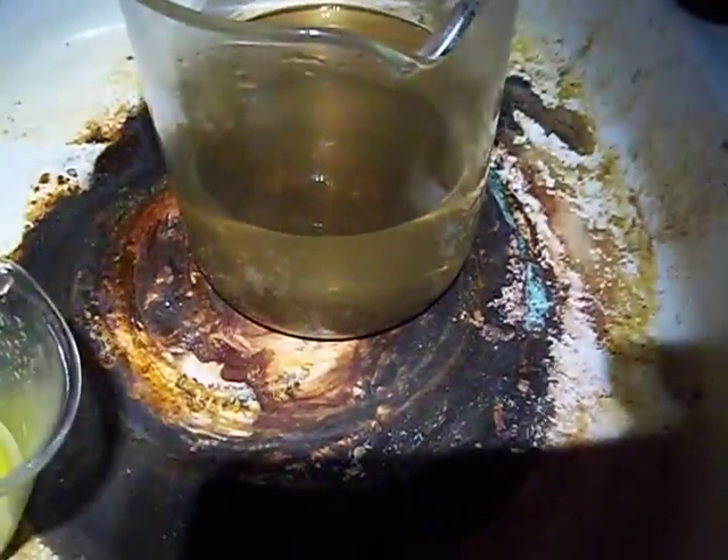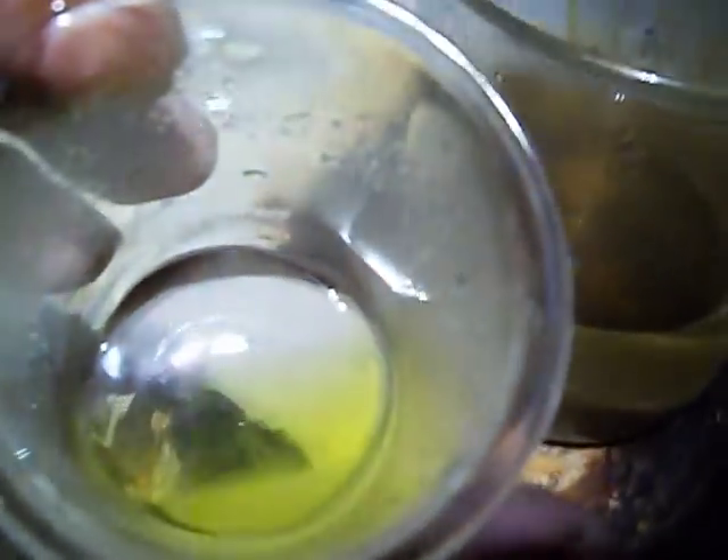This is a drop I did just a few minutes ago, and that's the silver chloride that fell after I got it filtered out. As you can tell, this is at night and I'm using a light. The solution still looks yellowish, but I'm thinking it may need to be dissolved again.